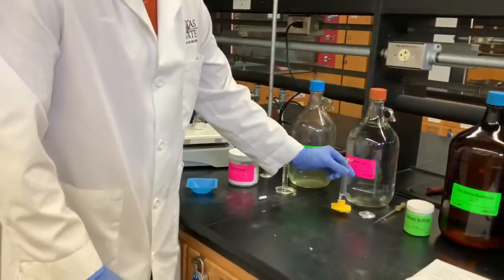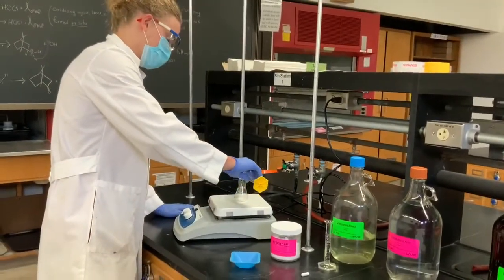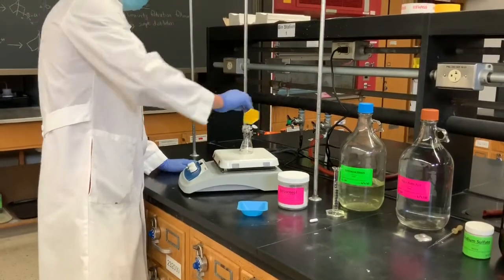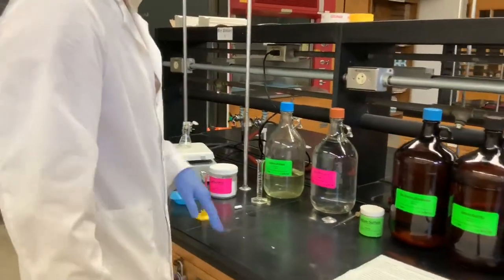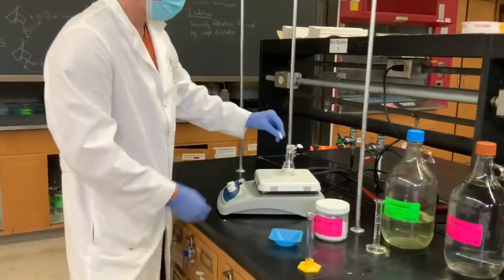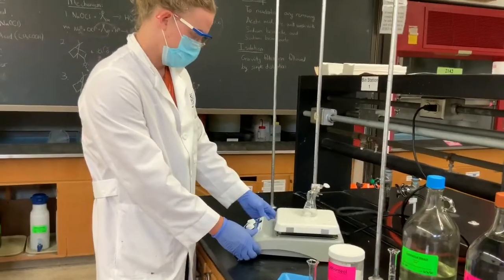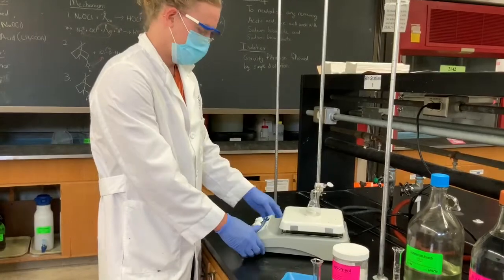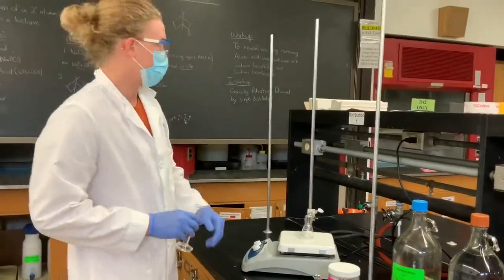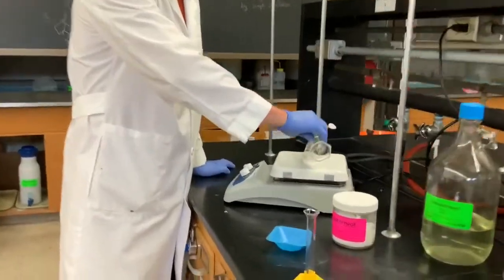Next, what we're going to do is add three milliliters of glacial acetic acid. And then we're going to add the stir bar — this is to get the isoborneol to start dissolving. And then finally, we're going to add eight milliliters of the commercial bleach, and that's going to get our hypochlorous acid into solution so we can start oxidizing this alcohol.